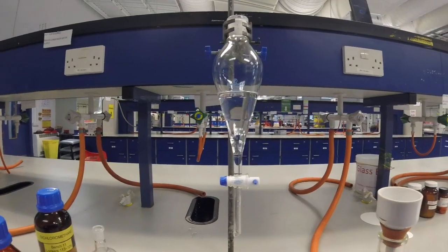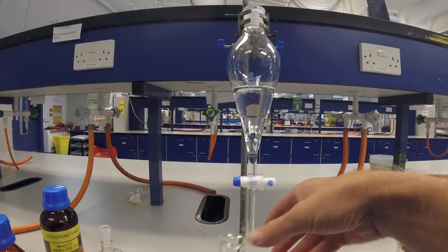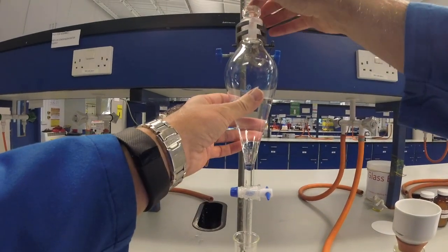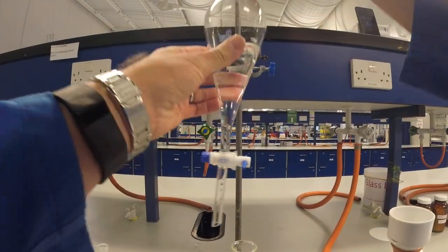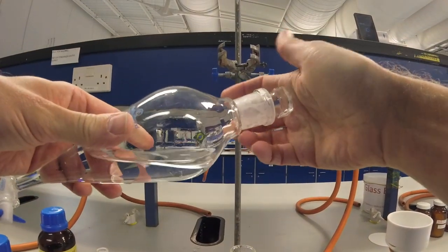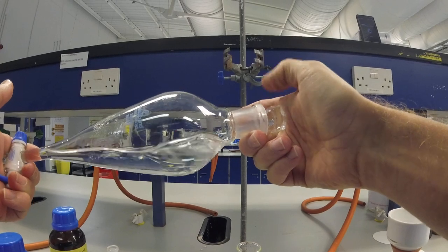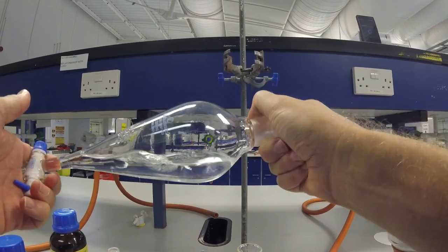So you want that top layer. So the first thing we're going to do is we're going to put the top in and then take this out. Make sure you hold your hand over the top of the stopper to keep it in place just in case of any build-up of pressure.